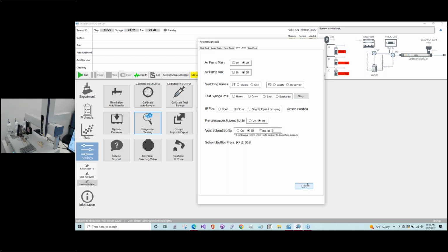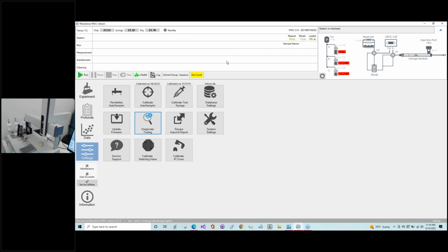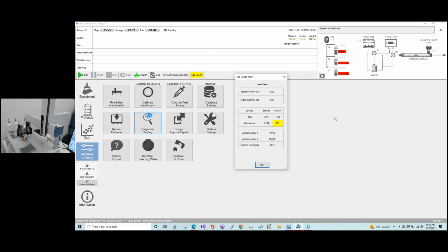So now I think we're going to move on back to what can you change and what will you need help from a field service representative? Just a quick review, one of the improvements that we had with the Initium Model 1 Plus versus the original is that there's some more self-sufficiency and not necessarily so much need for the field service engineers to come. So there are some things that you still do need them to do, but we'll go through all the things that you can do and what you then need to contact the field service for. So the first ones up here are the O-rings.